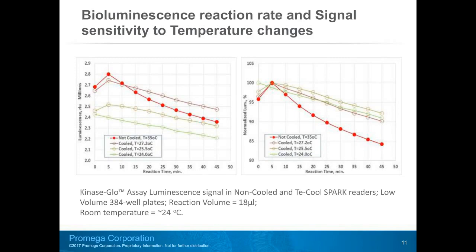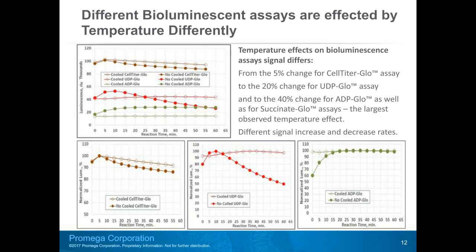This slide highlights how sensitive the reaction signal is to even small temperature variations. We are looking at the Kinase-Glo luminescence signal over time. Shown in red is the curve produced by a not cooled reader operating at 35 degrees Celsius internal temperature. Temperature on the T-cool Spark was adjusted in small increments and the Kinase-Glo assay signal measured repeatedly, with each temperature increase of 1.5 degrees Celsius, signal intensity increases.